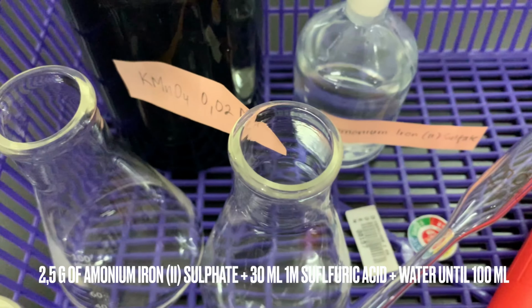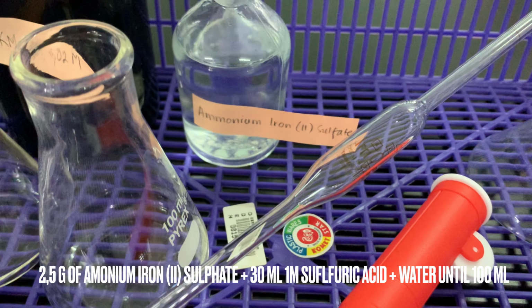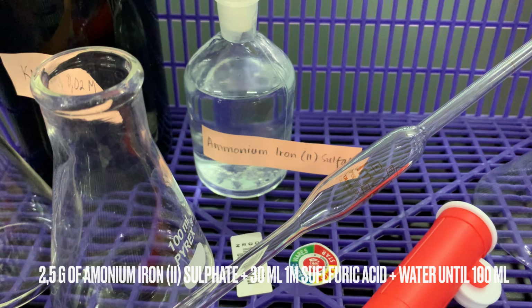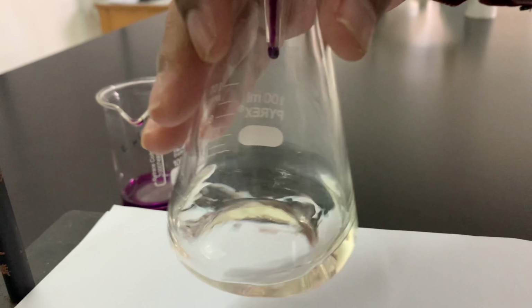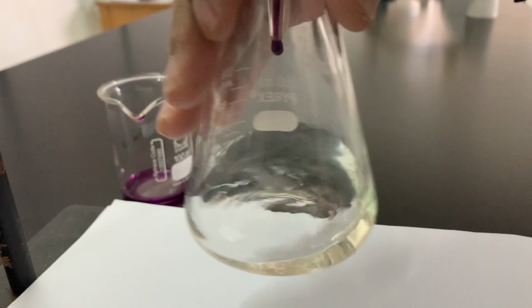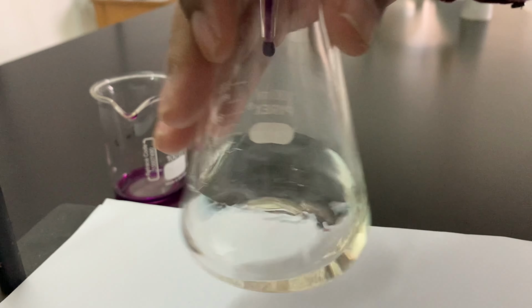For this experiment, 2.5 grams of ammonium iron 2 sulfate crystals are dissolved in water and 30 ml of sulfuric acid in a 100 ml volumetric flask. A 10 ml sample of this solution is then titrated with 0.02 molar potassium permanganate.